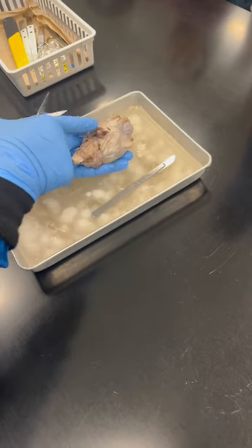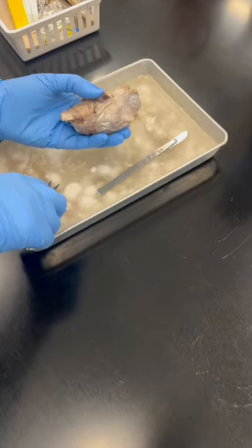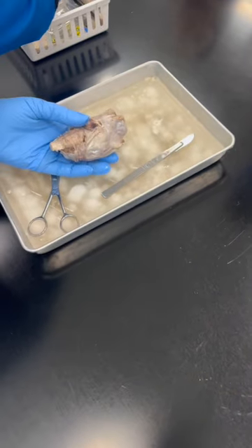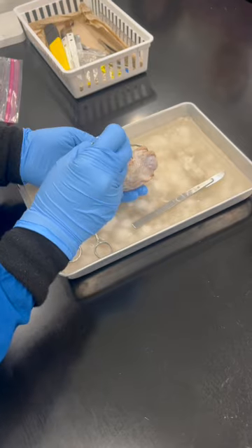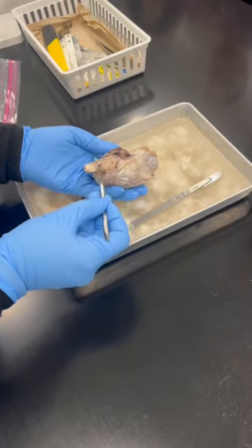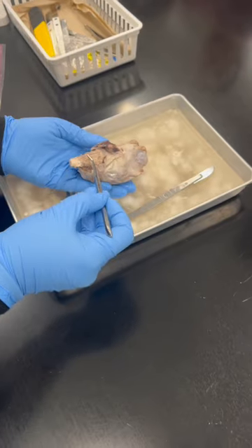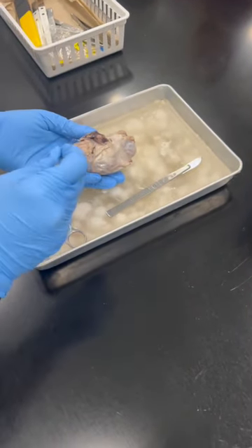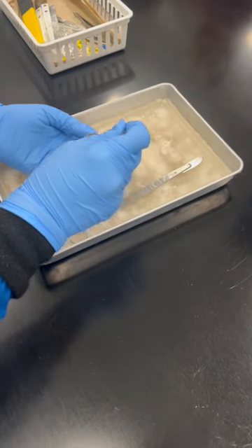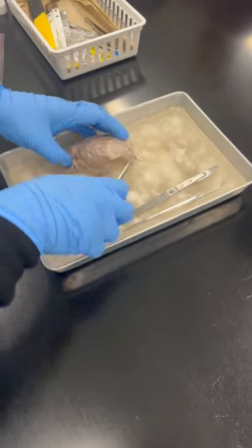Then also this structure is the pituitary gland. See this one, pituitary gland. This is an olfactory bulb. Do you know what this structure over here is? Brainstem. Then this over here, spinal cord. Spinal cord, brainstem, pituitary gland, olfactory bulb. So the optic nerve we can see over here once we cut through the dura mater.